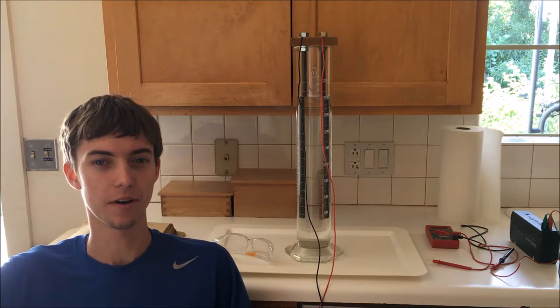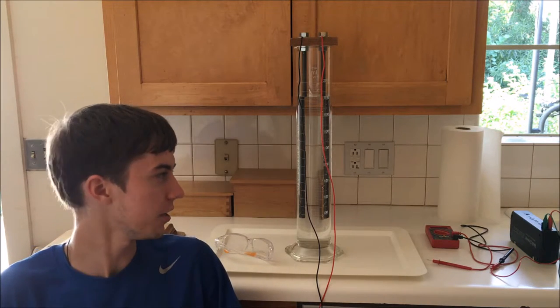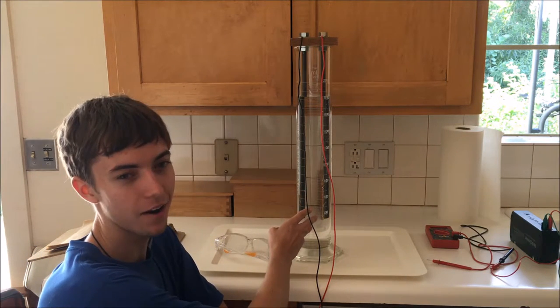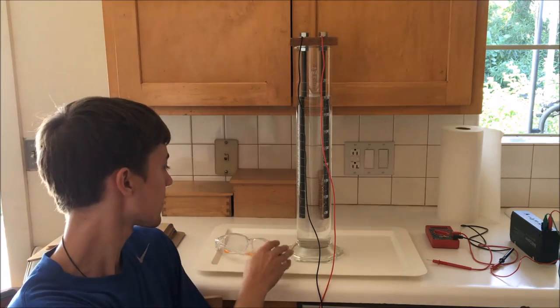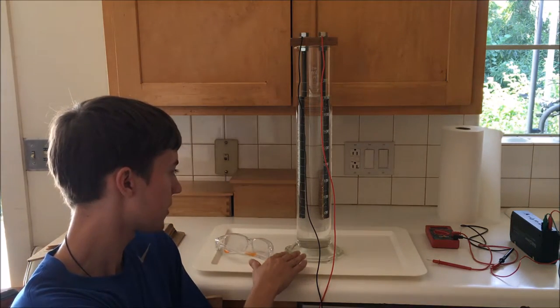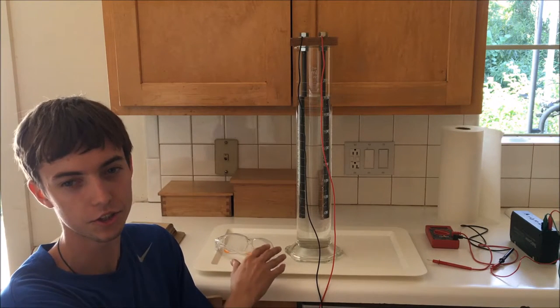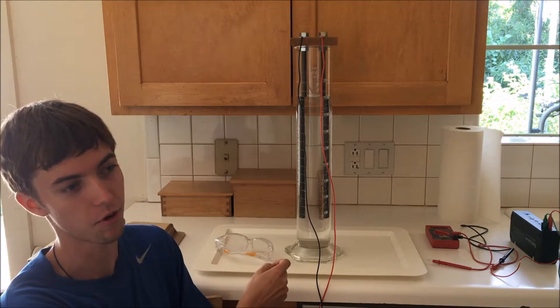I'm going to be starting a long-term experiment in which I attempt to enrich dihydrogen monoxide, also known as regular water, into a water solution containing a high concentration of deuterium, also known as heavy water.